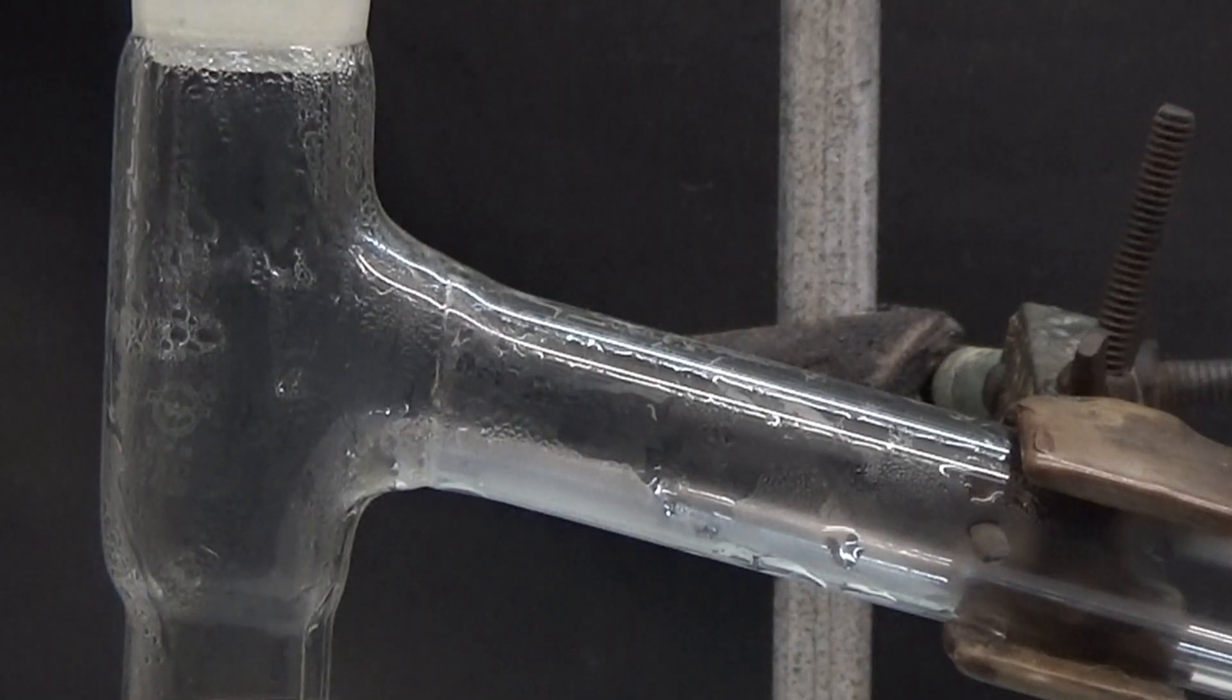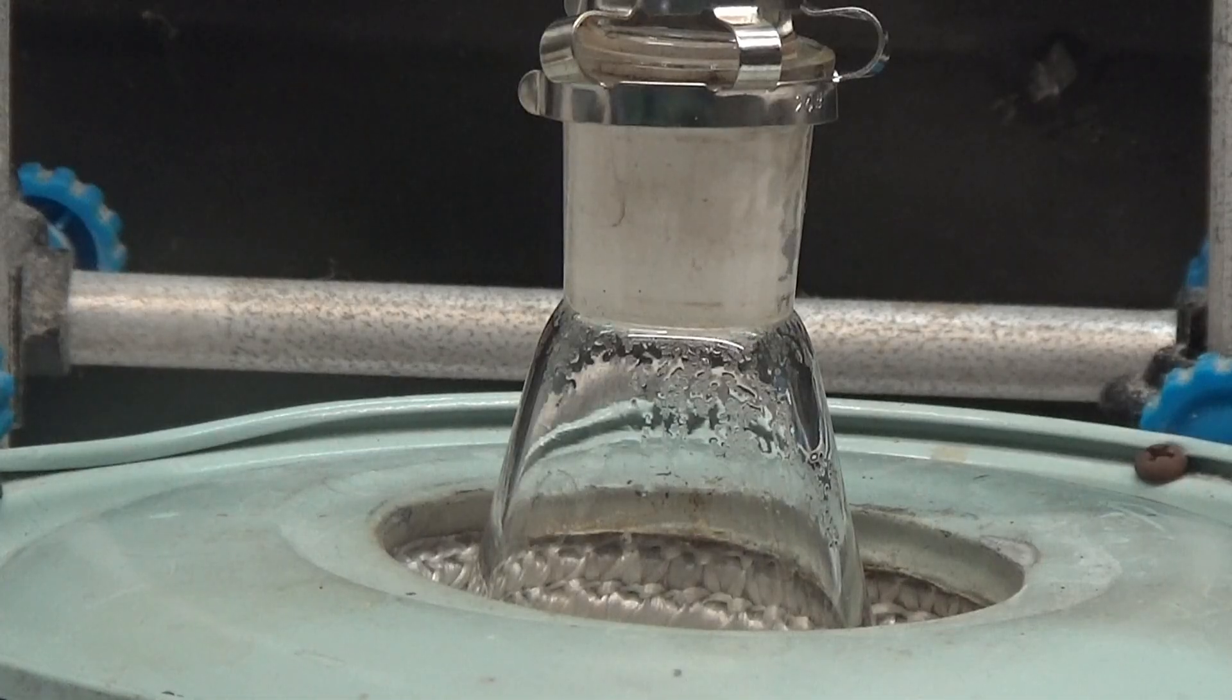At first, it was observed that water distills into small droplets, and when they fall on the molten succinic acid, these droplets explode strongly.